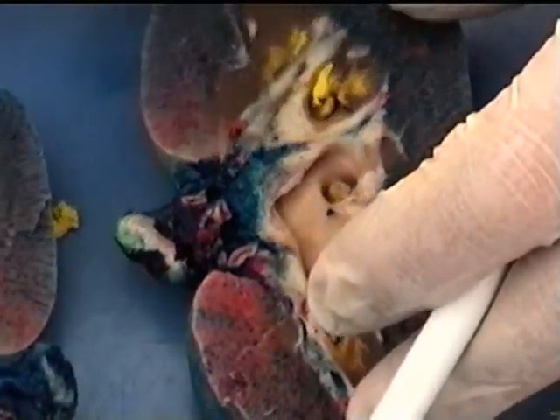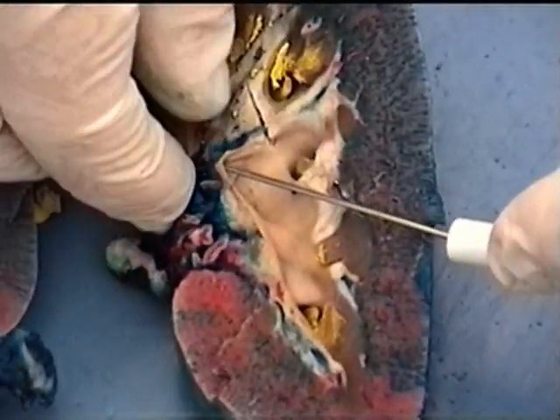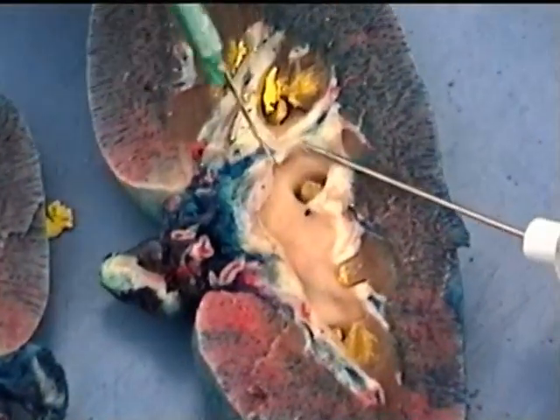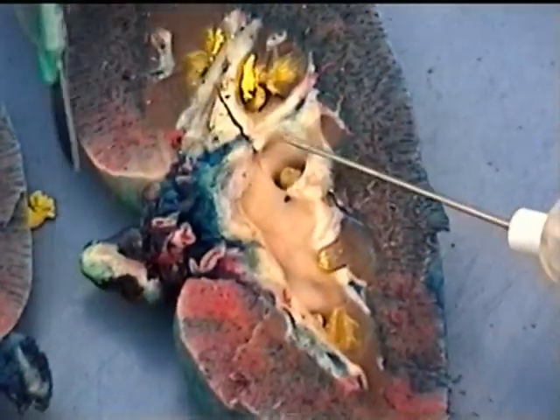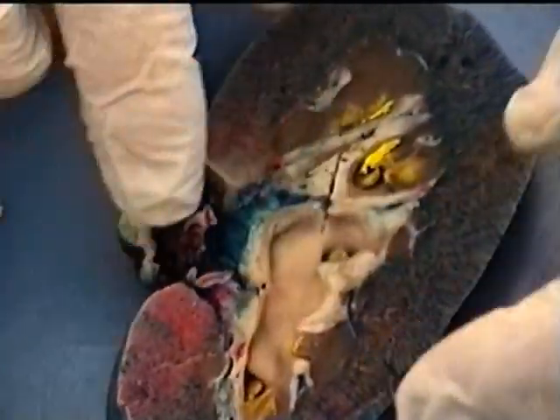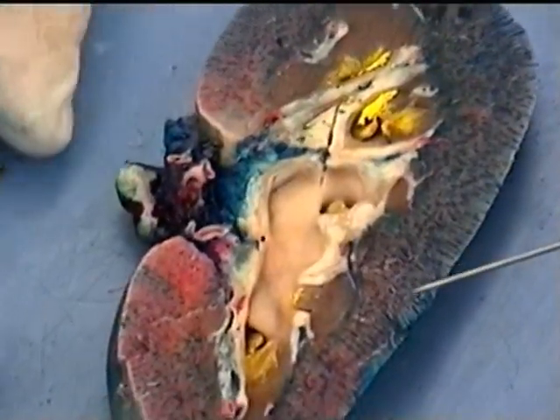So when you do this, it's kind of fun, you can take a scalpel or a knife, a pair of scissors, and you can cut this tissue, and then as you pull it back, you can see how this network of minor calyces, major calyces, and the renal pyramid all come together to supply a mechanism by which urine is collected and carried away from the kidney.